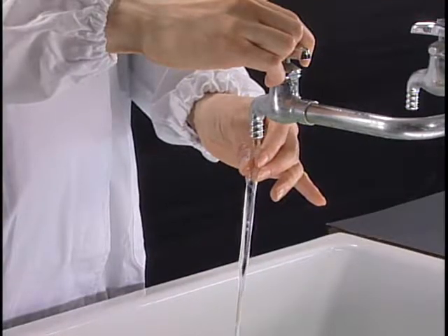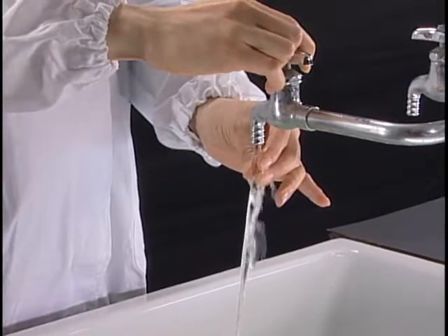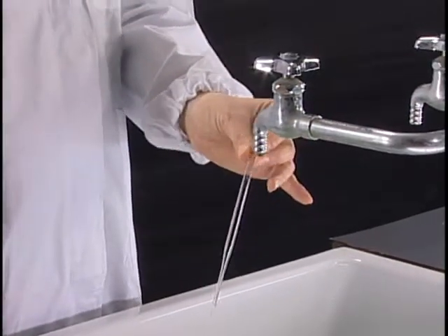After use, remove the pipette bulb from a transfer pipette and wash the pipette by rinsing under tap water followed by distilled water.